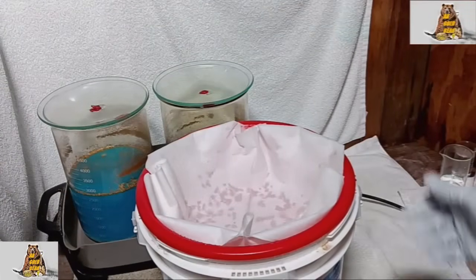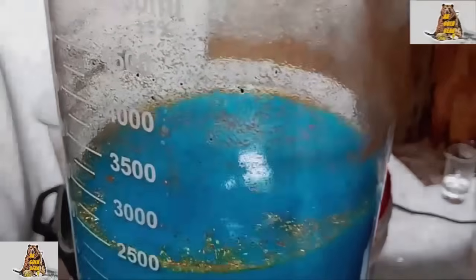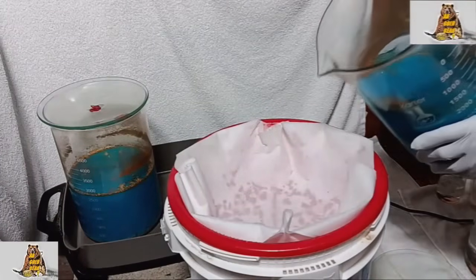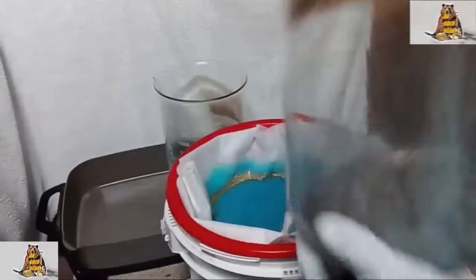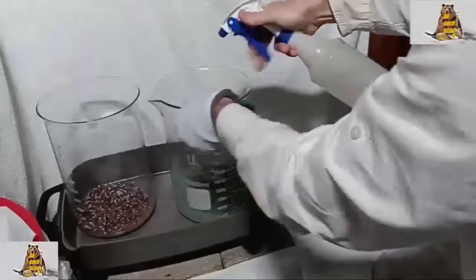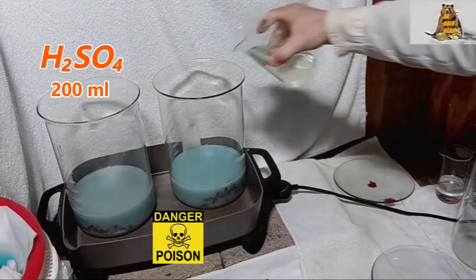The density of the copper nitrate in the solution is too high. I need to change the acids. Gold flakes on the top. Still a lot of copper. Water — 100 ml.